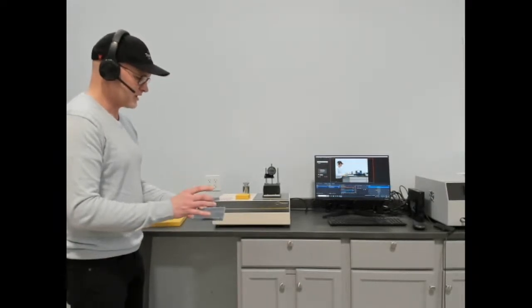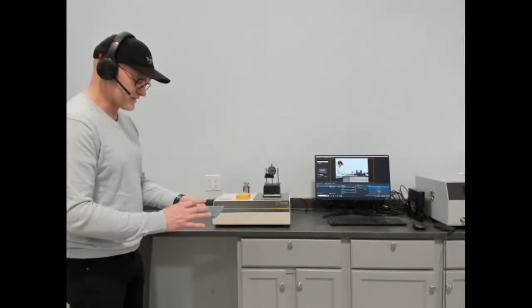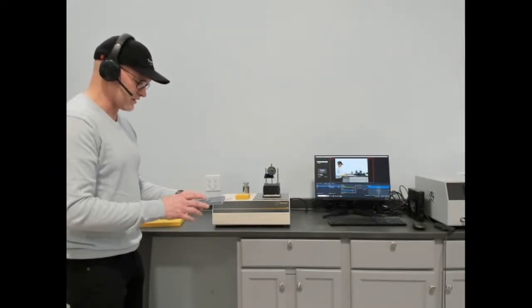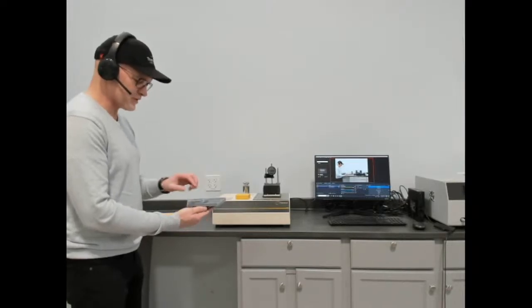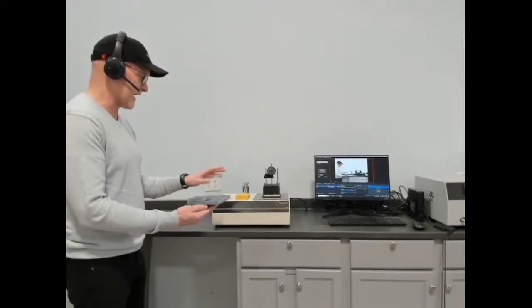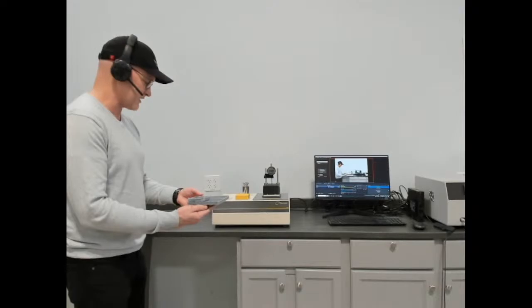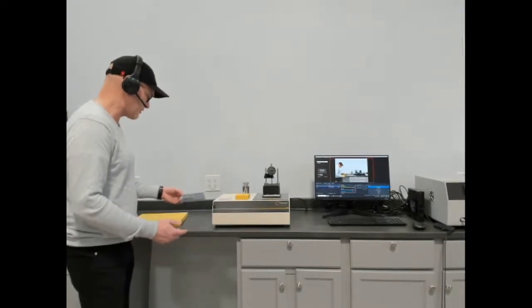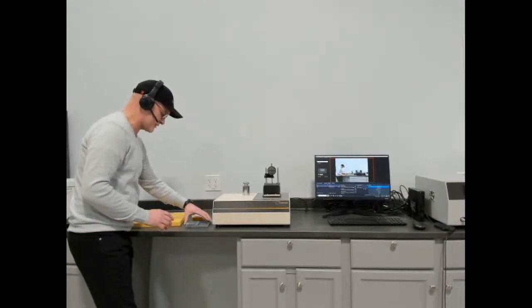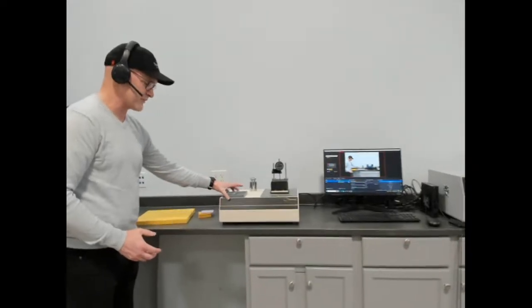We're going to set this up, and we'll open the software and show you the typical setup and the steps, and then we'll show you the start of the measurement, and then we'll show you the data on review. The typical measurement time for the HFM-25 is in the 20 minutes to half an hour category, because it is a much smaller material, so it typically is a little faster. So we've already calibrated the instrument, so we're just going to show the setup that you would typically do.